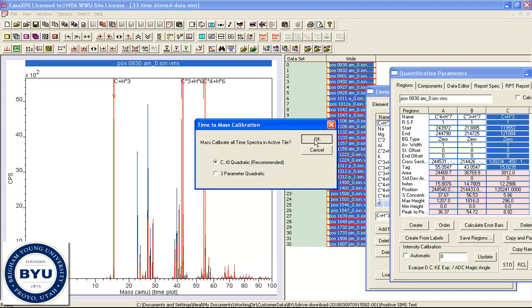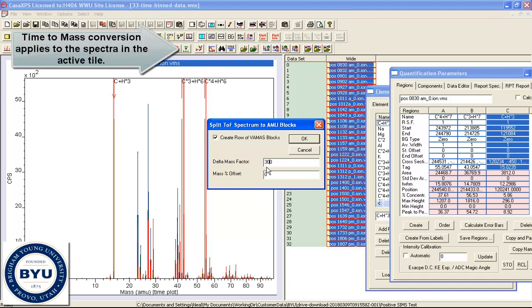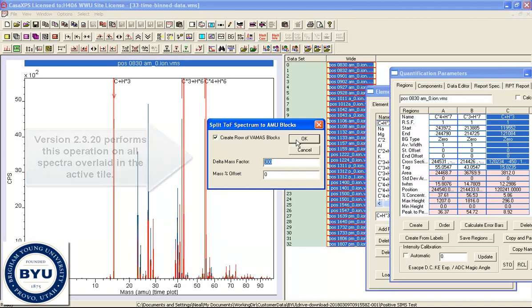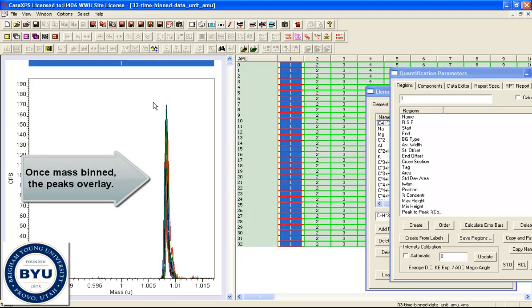So we'll press OK, and as a consequence of that, each of these spectra have now been calibrated within CASA XPS. So when we convert these from time to mass intervals, and I'll give it a range of 300 for the delta mass factor, that'll increase the number of mass channels in the new VAMAS blocks that will be created. I press OK, and then once again, if I overlay, now we can see that the hydrogen lines up much better.